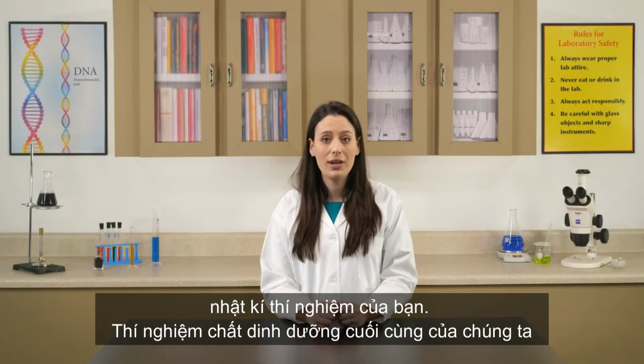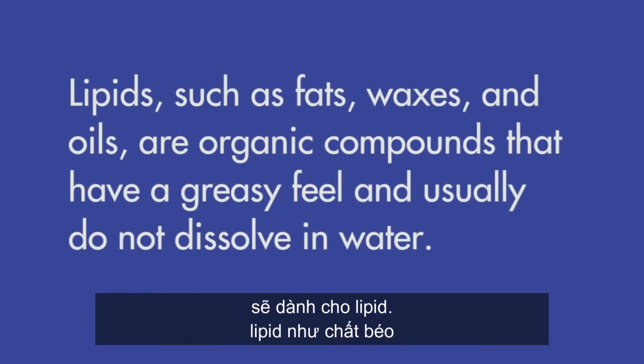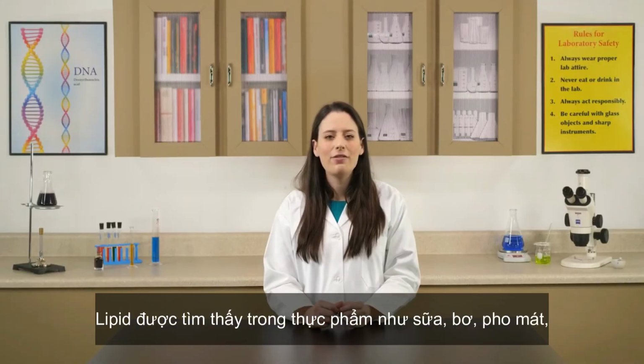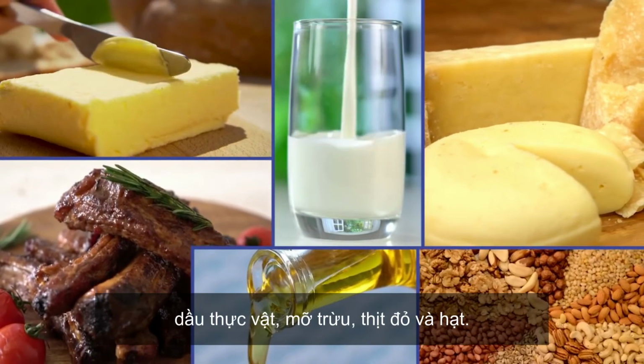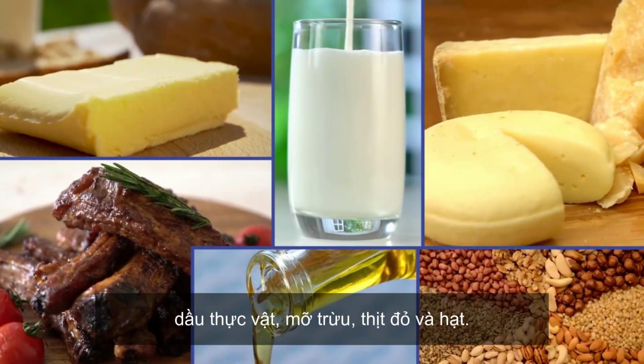Our last nutrient test will be for lipids. Lipids, such as fats, waxes, and oils, are organic compounds that have a greasy feel and usually do not dissolve in water. Lipids are found in such foods as milk, cheese, butter, vegetable oil, shortening, red meat, and nuts.